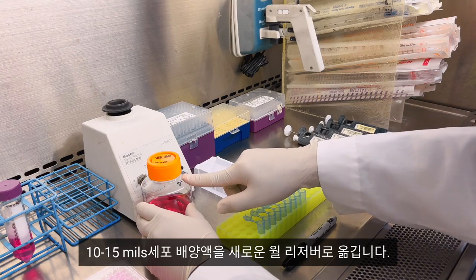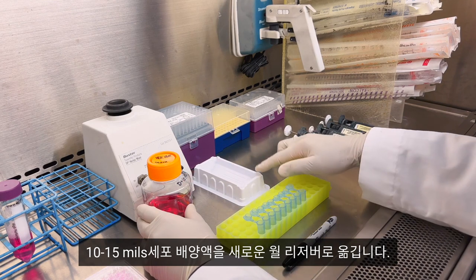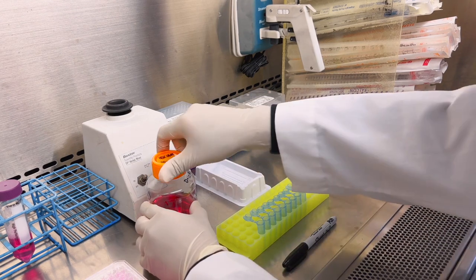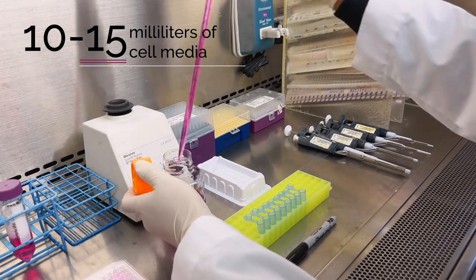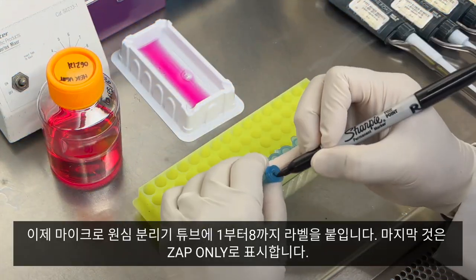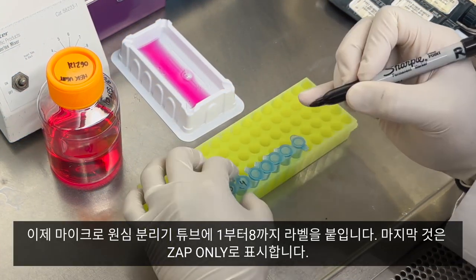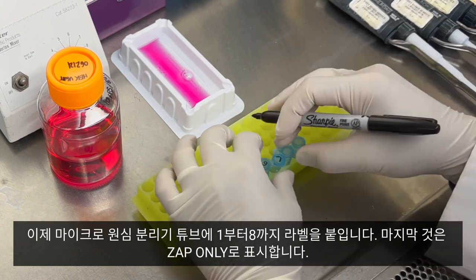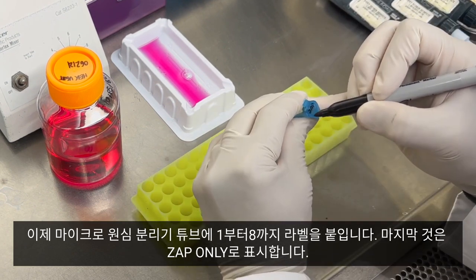Transfer 10 to 15 mils of cell media into a fresh well reservoir. Now we will label the micro centrifuge tubes one through eight. The last one will be labeled zap only.